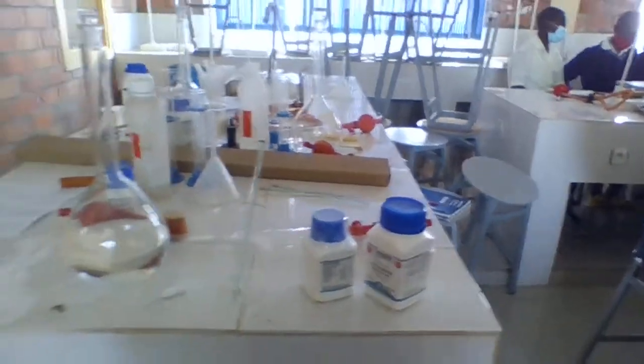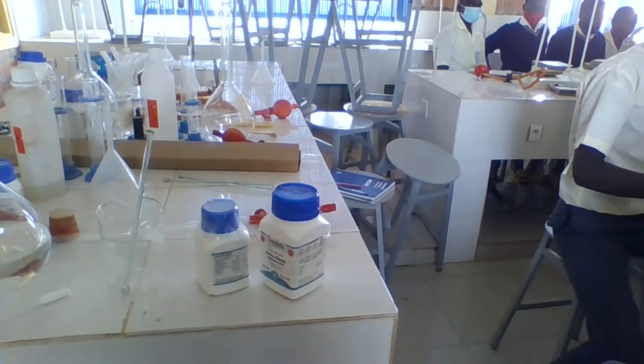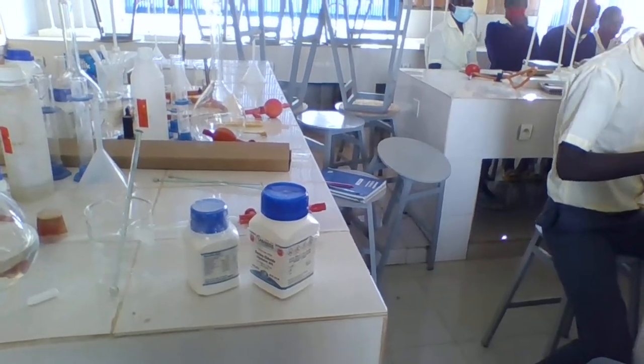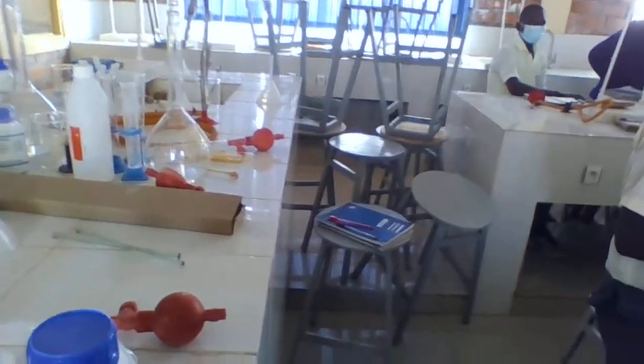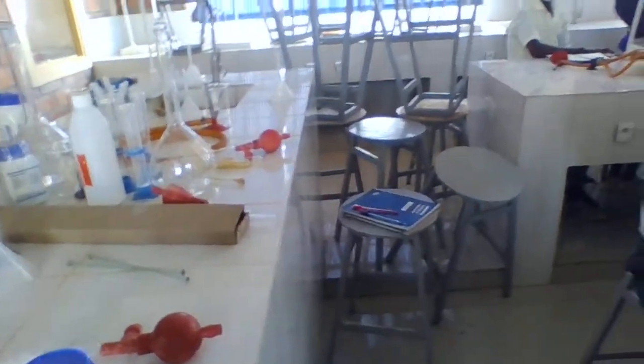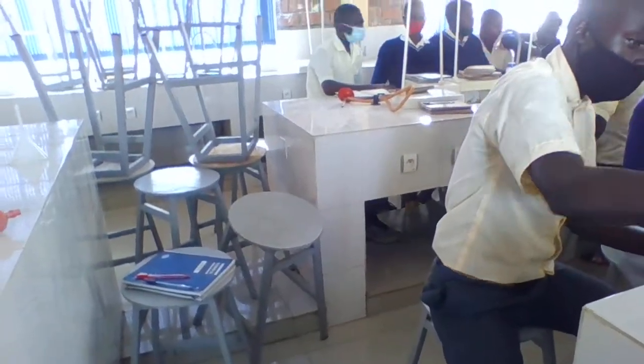First of all, put in water. If you have put water, you put reagent. You open and take a spatula of any reagent, and you write down the reagent you are using first. You open well, but not the sodium hydroxide.